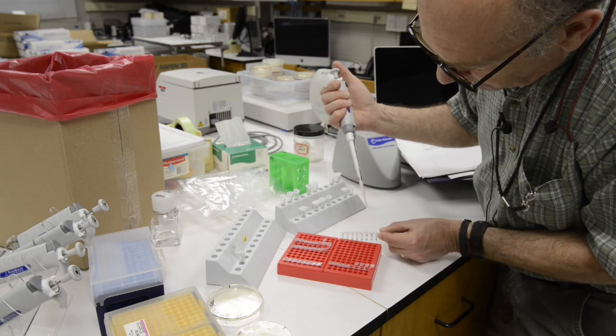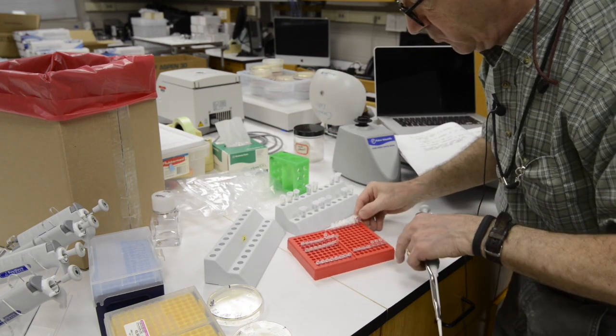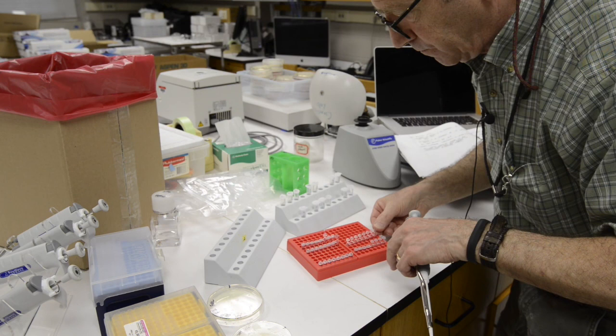And get them into a PCR strip. Close the caps as you fill each PCR tube, and then make sure those tubes are labeled appropriately, and then provide that strip of PCR tubes to your instructor.